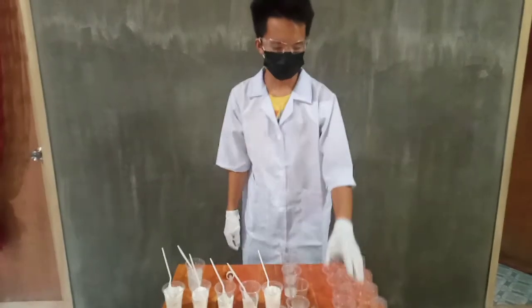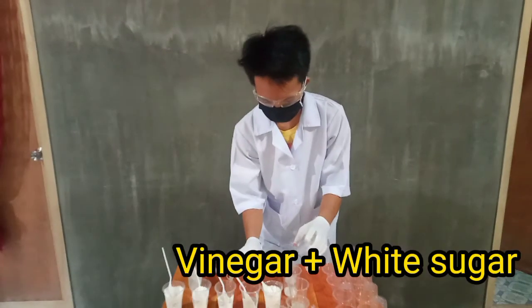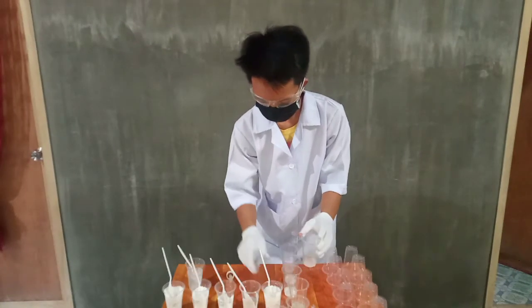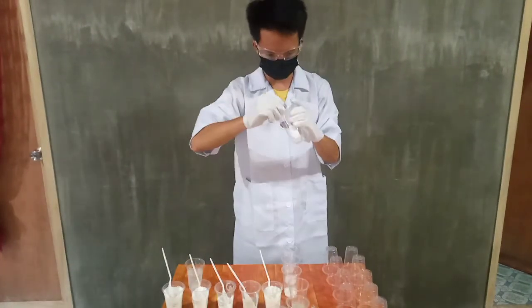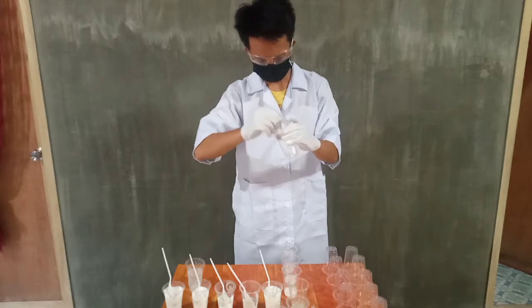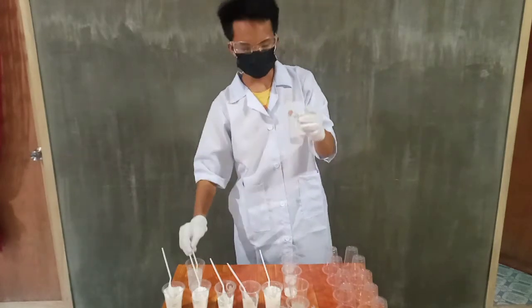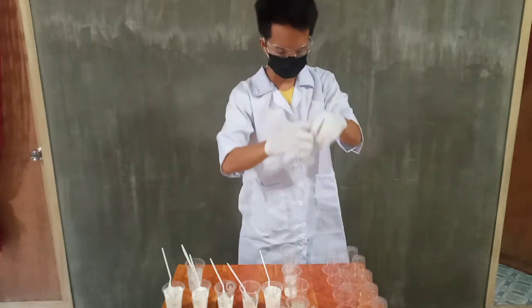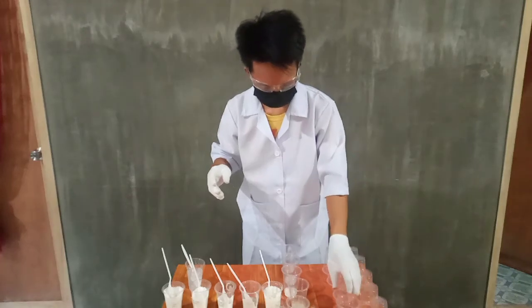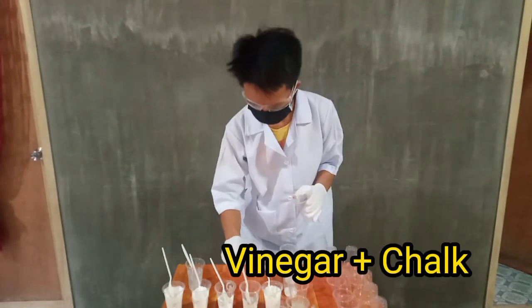And now let's witness the mixture of white sugar and vinegar. In this mixture, white sugar dissolved in the vinegar. The next one is the chalk and vinegar mixture.